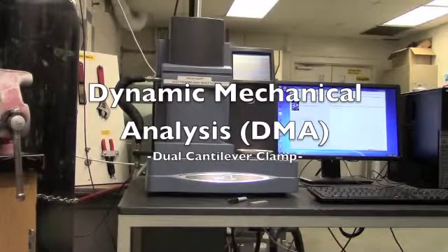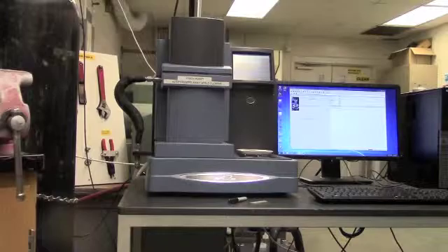Hello and welcome to the instructional video for the Dynamic Mechanical Analyzer, or DMA.